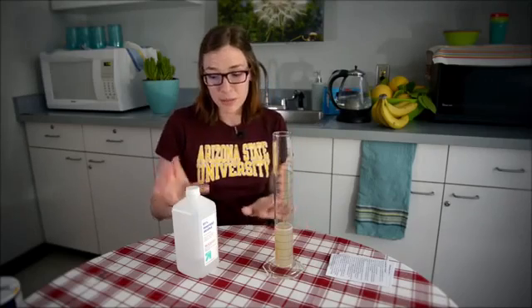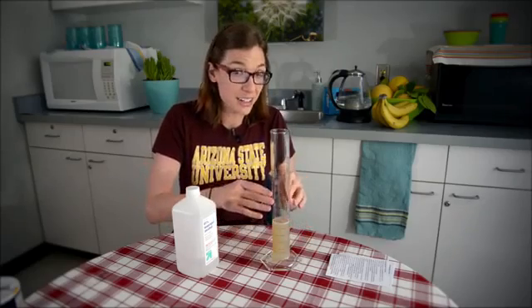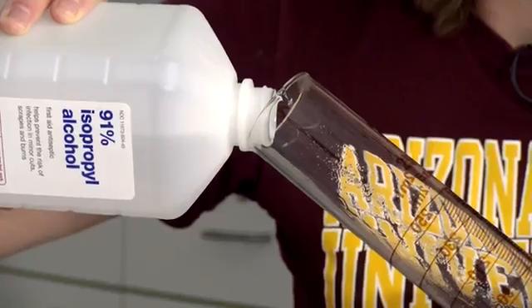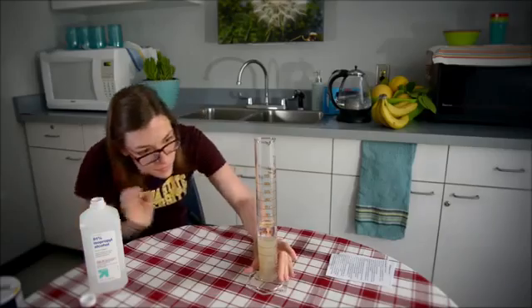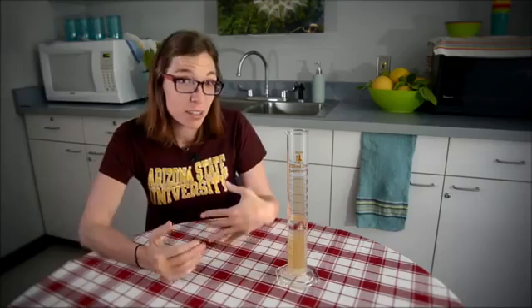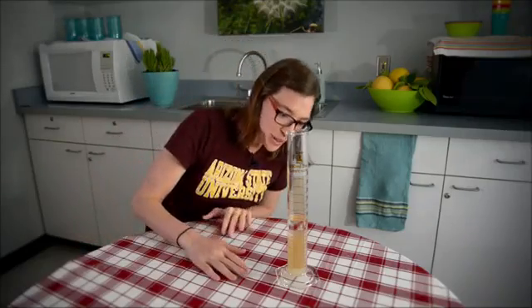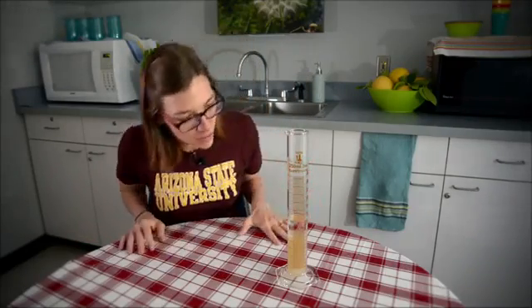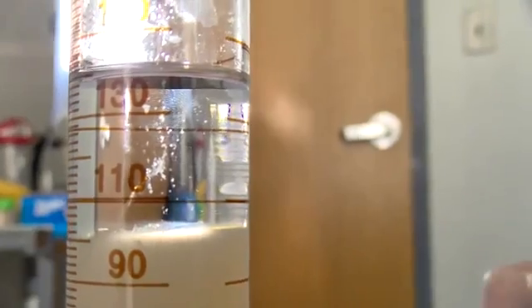We want to really try to keep the alcohol separate from this mixture because the DNA is going to precipitate, or come out, into the alcohol mixture. We'll try to add two and a half to five centimeters, or one to two inches, to it. And now we wait. The longer you let it sit, the more separated you'll be able to see the two different parts. Sometimes you'll see lots and lots of DNA, sometimes you will only see a couple small strands — and that's part of science. Those little bubbles are sticking along strands of the banana DNA.